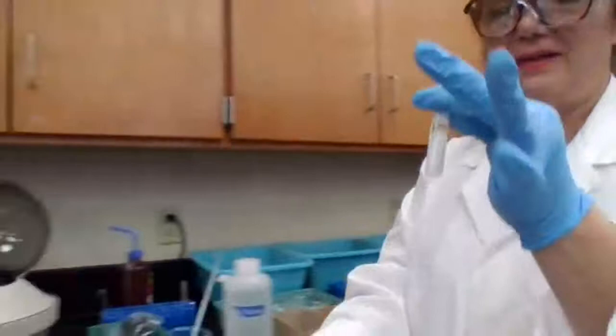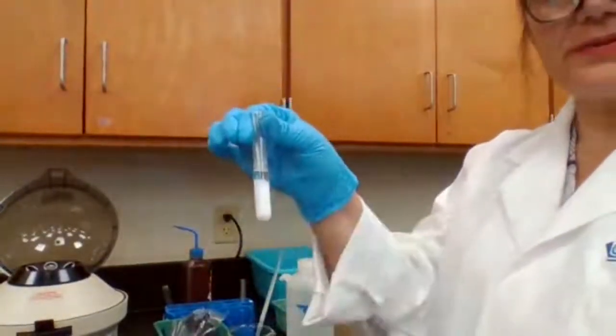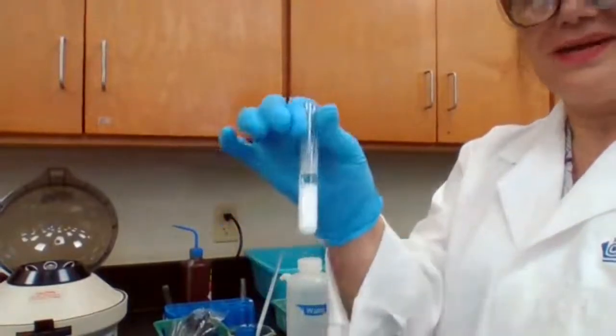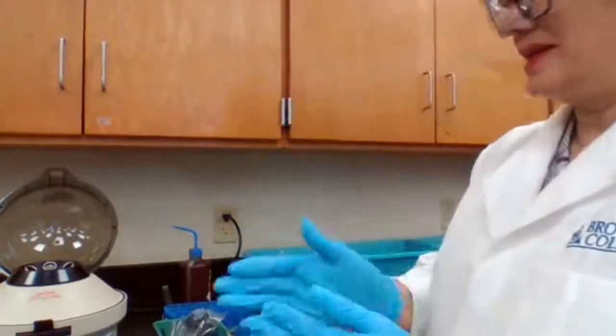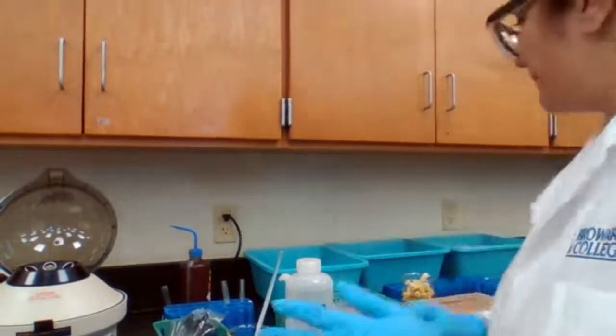Right now, you might think, yes, we knew that we have silver ion, but your observation is going to help you identify if you have silver ion for your unknown or you don't. Okay, you're done with the silver, it goes to the other test tube rack.